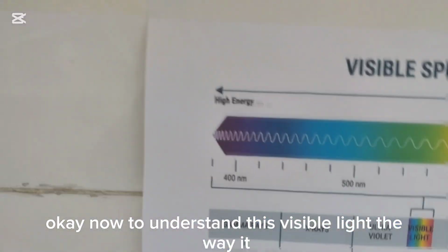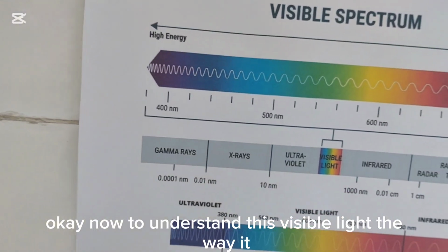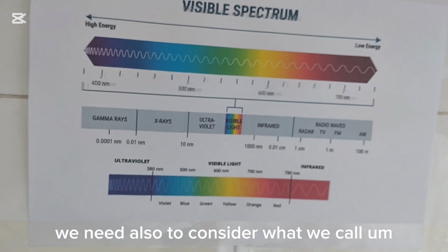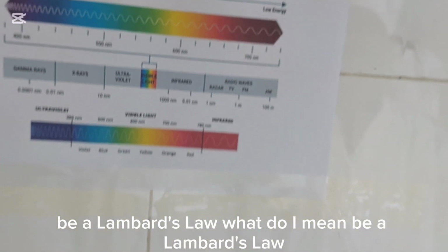Okay? Now, to understand this visible light, the way it interacts with matter, we need also to consider what we call Beer-Lambert's law. What do I mean? Beer-Lambert's law.